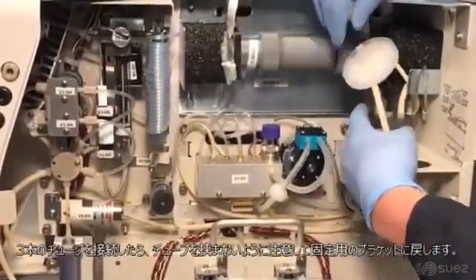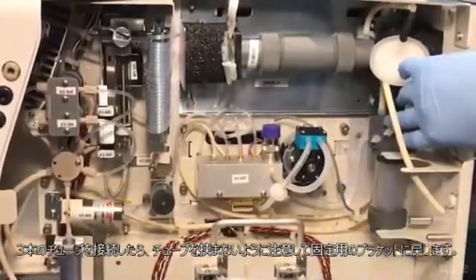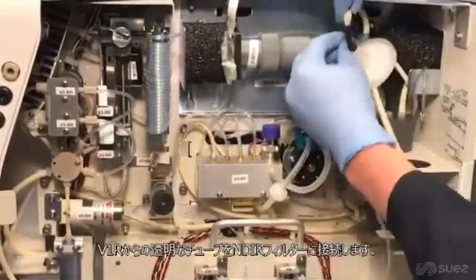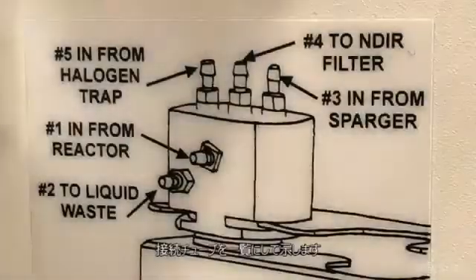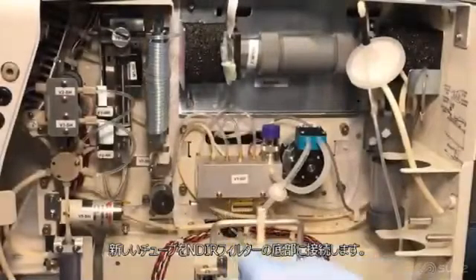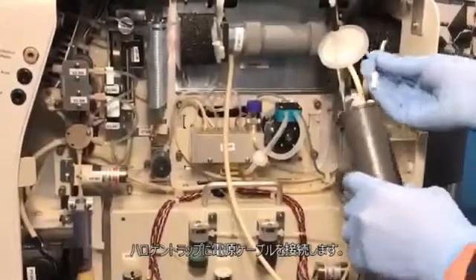Once the 3 connections have been made, place the gas-liquid separator back into the mounting bracket, making sure not to pinch any tubing. Reconnect the clear tubing extending from V1R to the plastic T between the NDIR filter and NDIR detector end cap barb. For easy reference, there is a schematic of the proper tubing connections located inside the analyzer to the right of the gas-liquid separator. Install a new section of tubing onto the barb on the bottom of the NDIR source end cap. Reconnect the halogen trap power cable.